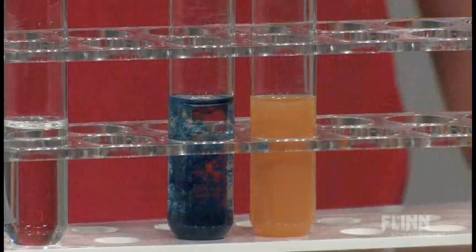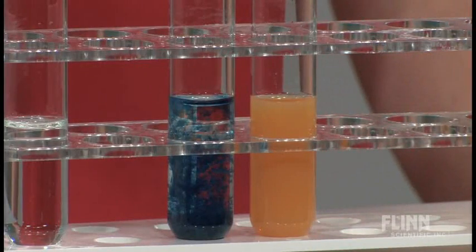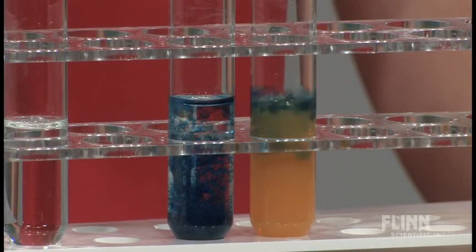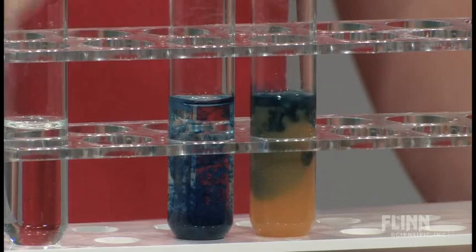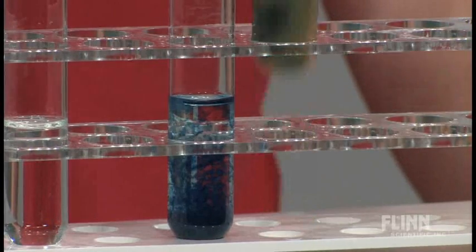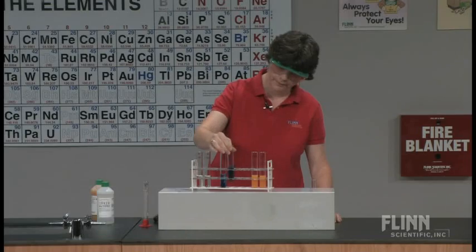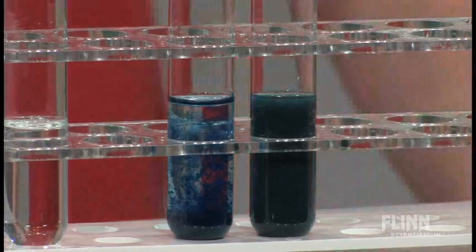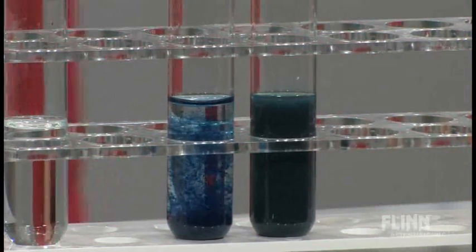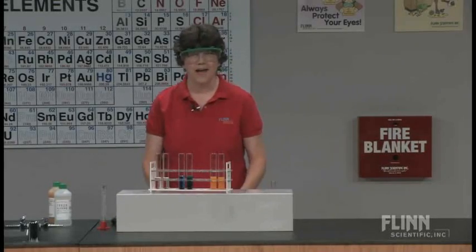If I add it to the three plus ion and give those a little swirl, I get what's called the Prussian blue color. So let's go to the board and see what's happening here.